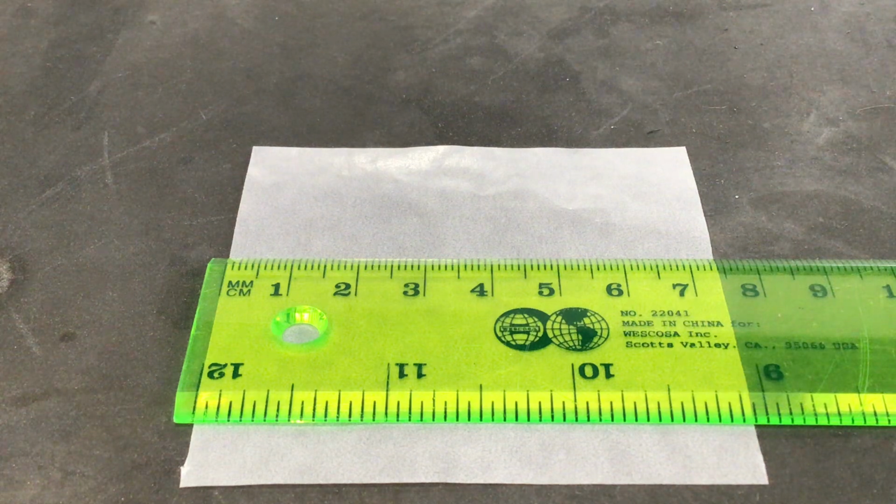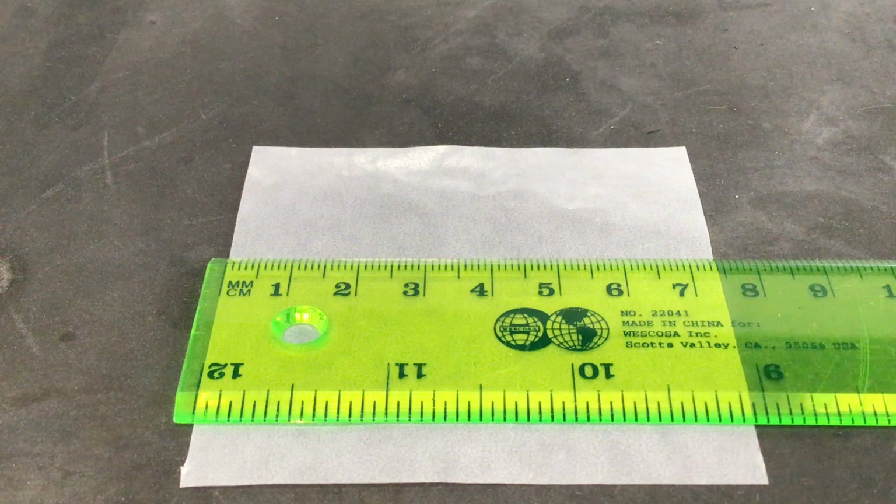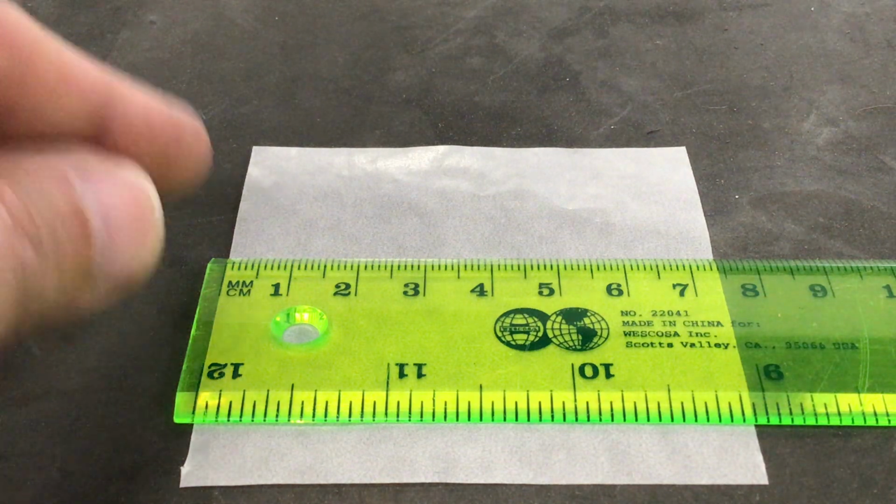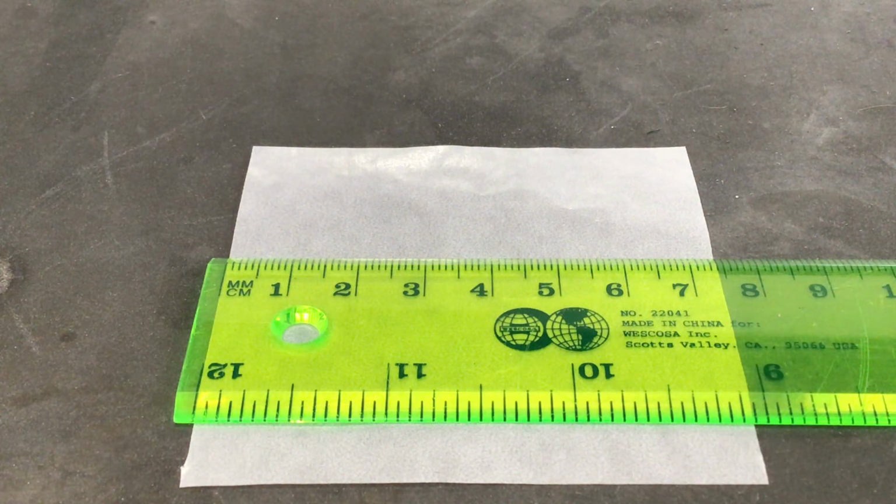But it's important that you're always going 1 decimal place past where those tick marks are. So again, on centimeters for a ruler like this, every tick mark is 1/10 of a centimeter, so I should be able to give 2 decimal places to any centimeter measurement. If I was reporting it in millimeters, it would be to the nearest 0.1 millimeter, because every individual tick mark is 1 millimeter on this ruler.